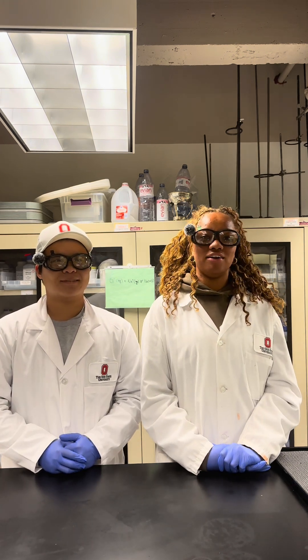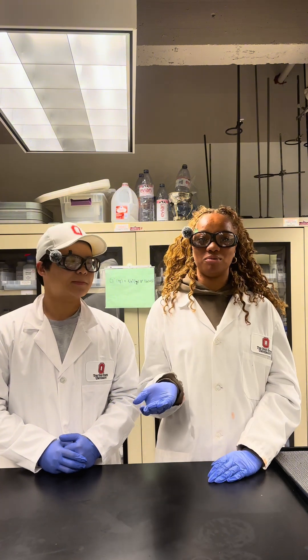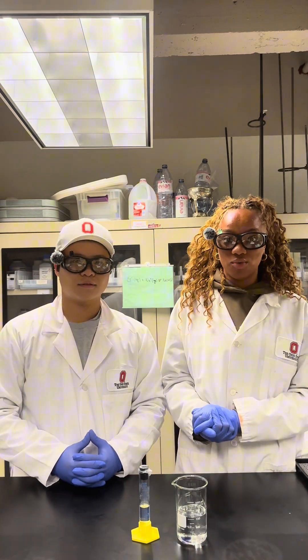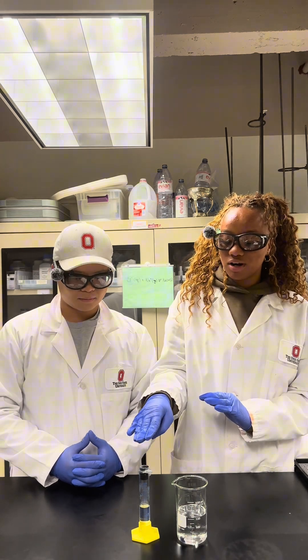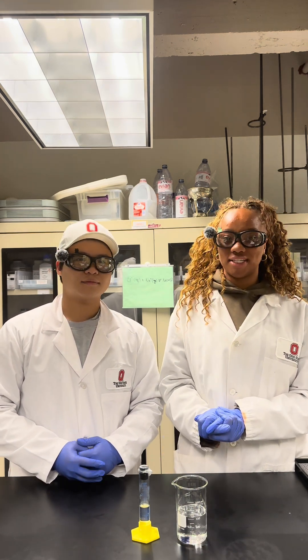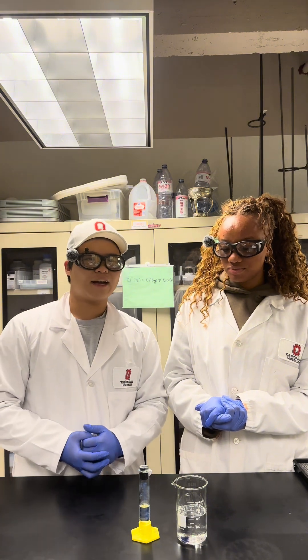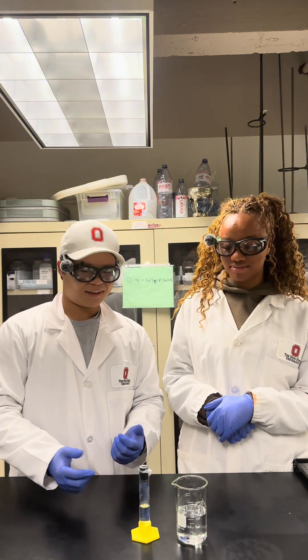Two aspects of the common ion effect are equilibrium and Le Chatelier's principle. We have a supersaturated solution of salt water, or sodium chloride, and also a super concentrated solution of hydrochloric acid, or HCl. Brian, what is the common ion between these two solutions? That would be the chloride ion. Okay, so let's see what happens when we combine the two.